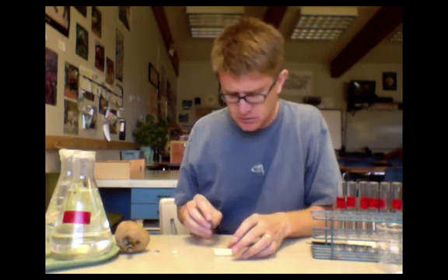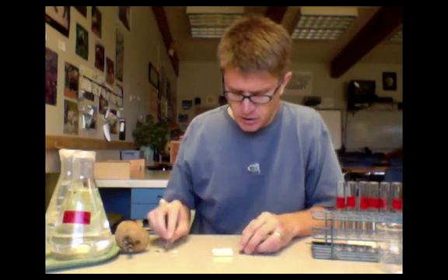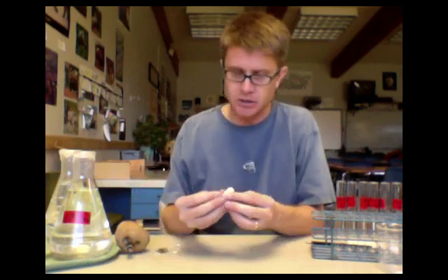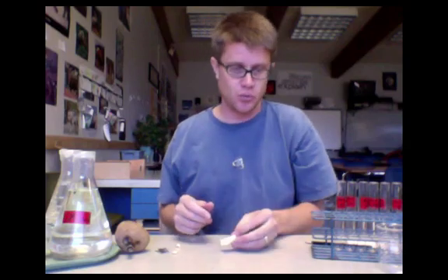We're looking at the percent change in mass, so if they're not exactly the same that's okay. You would cut them all off. These would be my potato cores for the zero molar water.